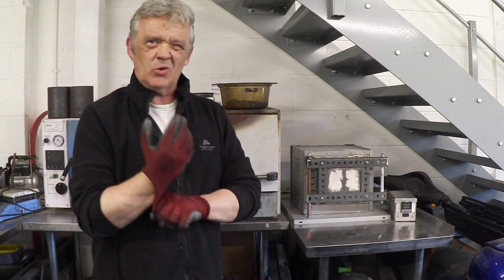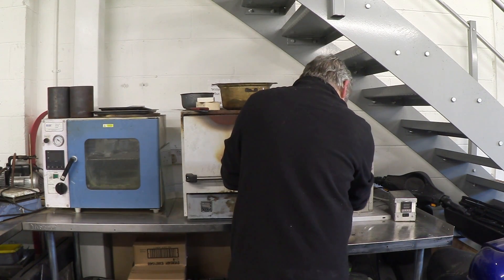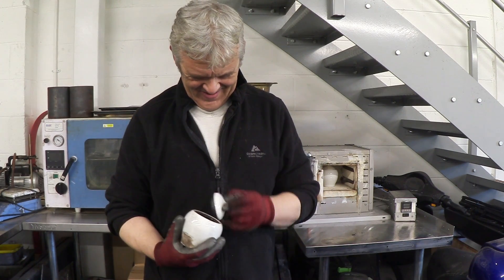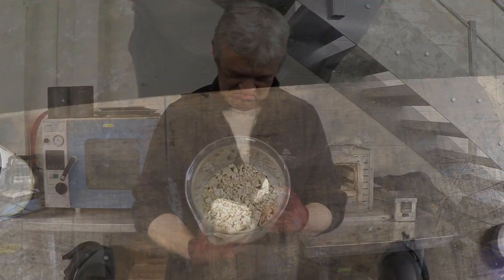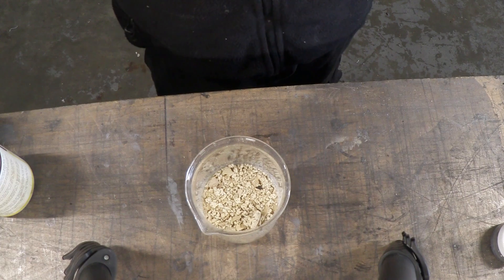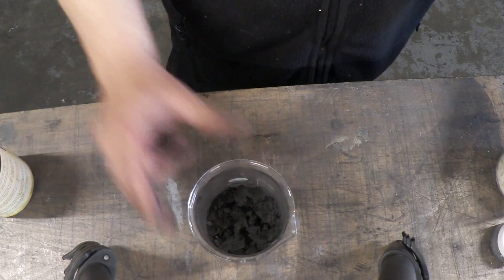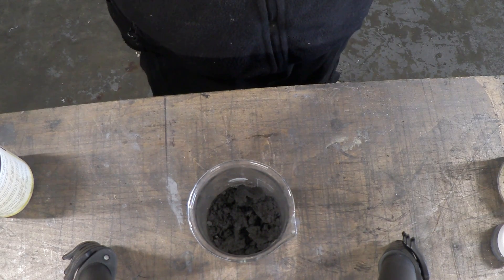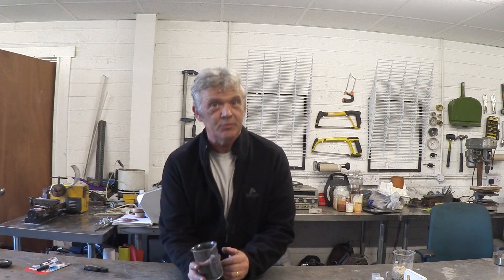I've turned it off and left it to cool for a couple of hours. There's our product — isn't that interesting! Here's a close-up of the two materials: this is the graphitic carbon nitride produced without the sugar in a previous video, and this is the material we've just produced, which has clearly created a carbon-doped graphitic carbon nitride.